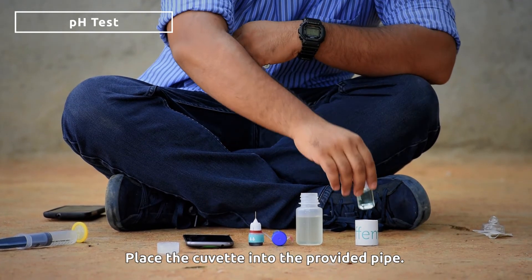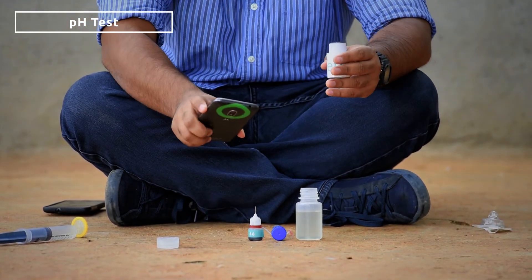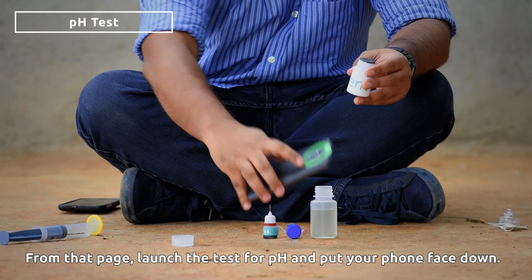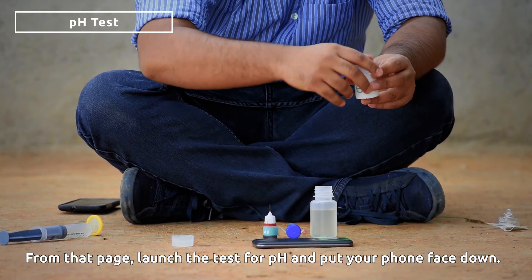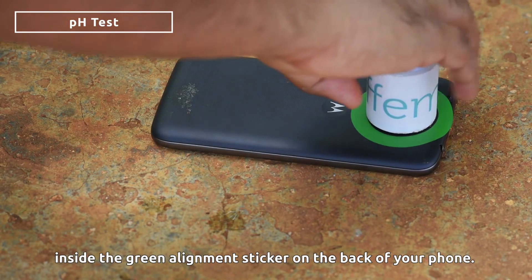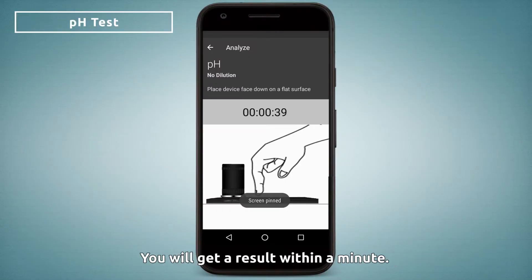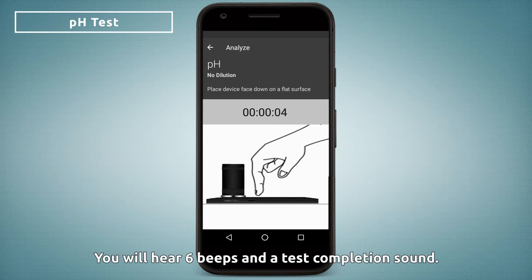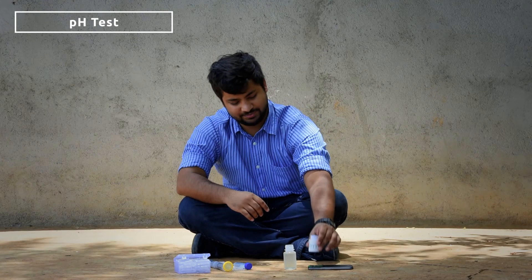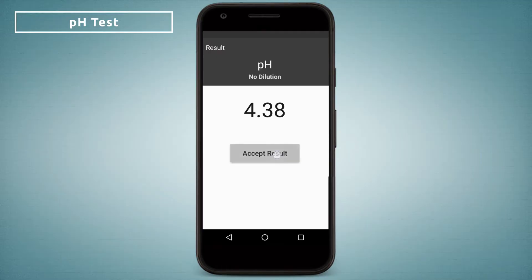Place the cuvette into the provided pipe. Launch the test for pH and put your phone face down. Place the pipe and cuvette combination inside the green alignment sticker on the back of your phone. You will get a result within a minute. You will hear 6 beeps and a test completion sound. Accept your result.